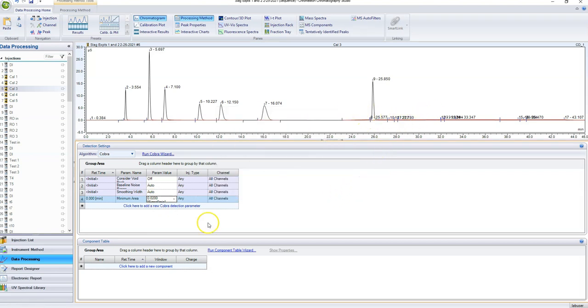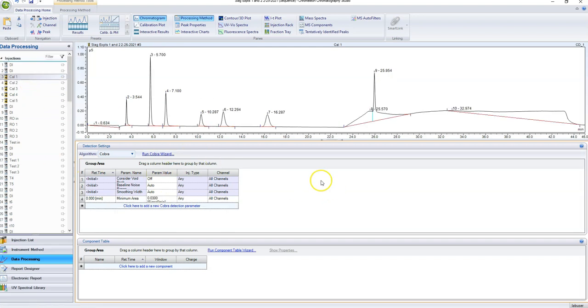There's still some peaks over there that are getting recognized, so basically you just keep doing this until you've gotten rid of all of the peaks that you don't really want anywhere. Alright, so this is fine. This is definitely manageable. So now that we've got the detection parameter set and pretty much only the peaks that we like are selected, I'll show you how to mess with some of these weird things in a moment here.